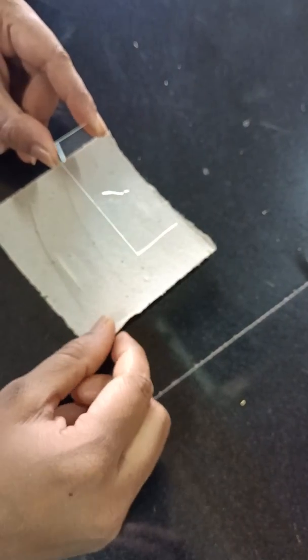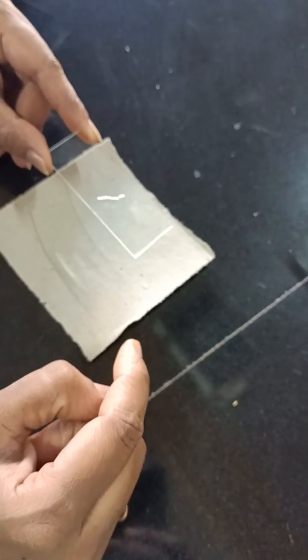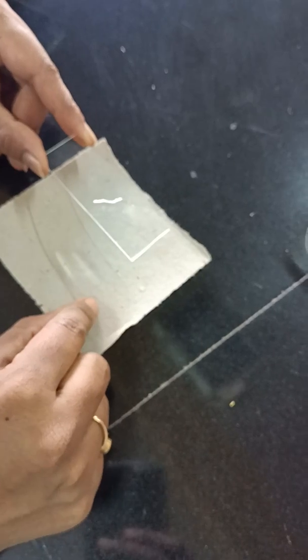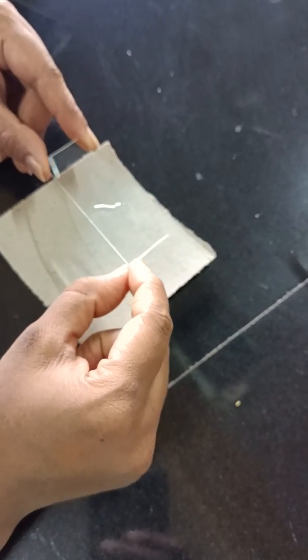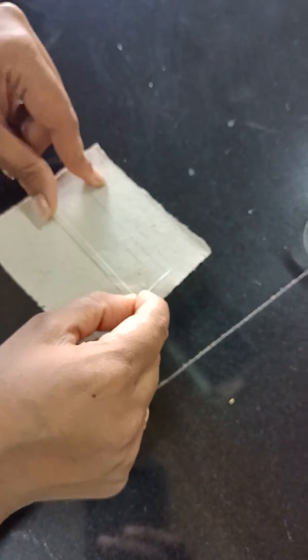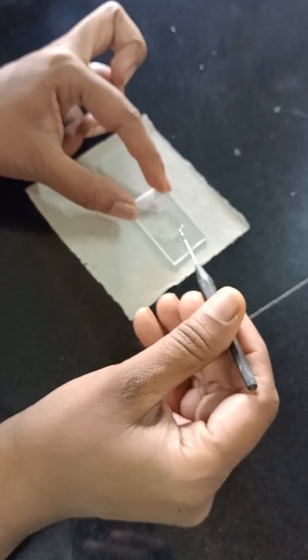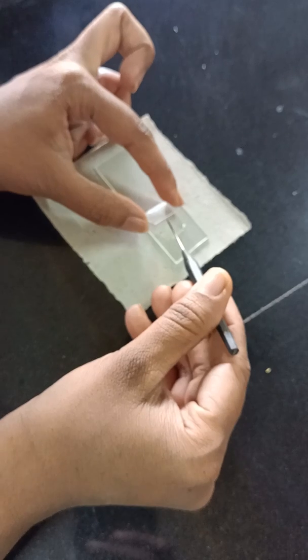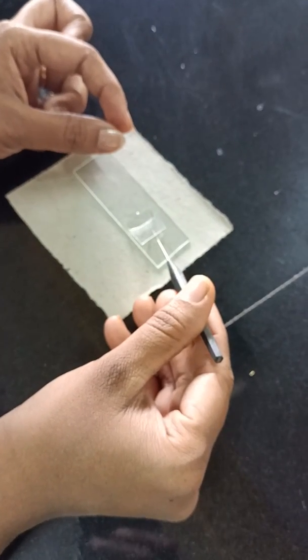In different conditions the pollen will undergo germination. You can calculate and mention the total number of germinated pollen grains using that formula, and put the results in a table. Here we are not giving time for germination, so we will just show you how the pollen grains will appear.